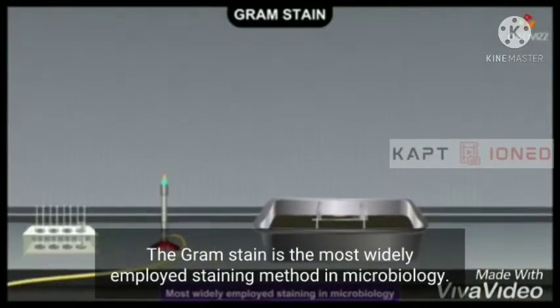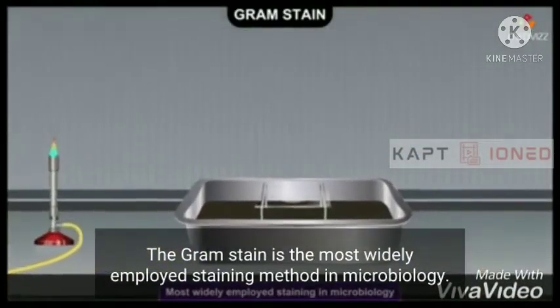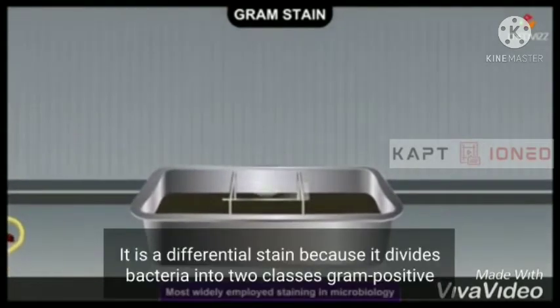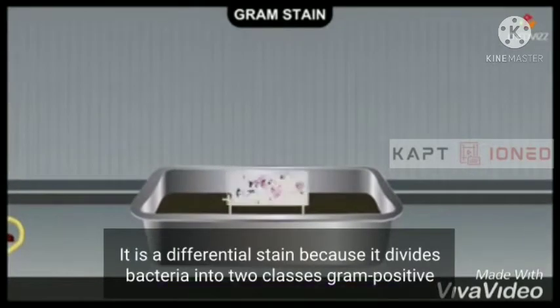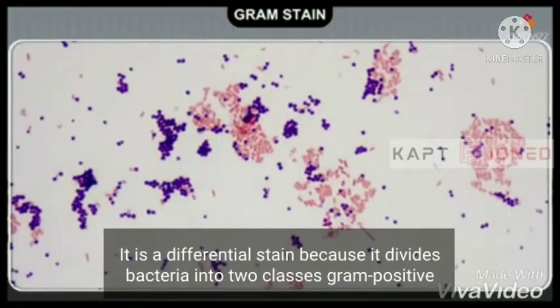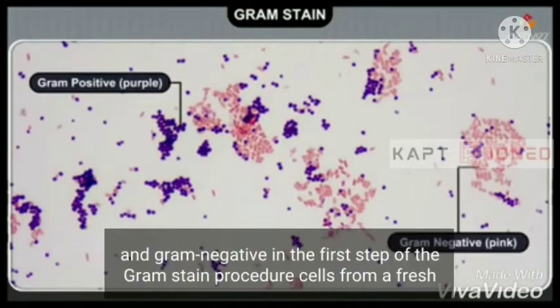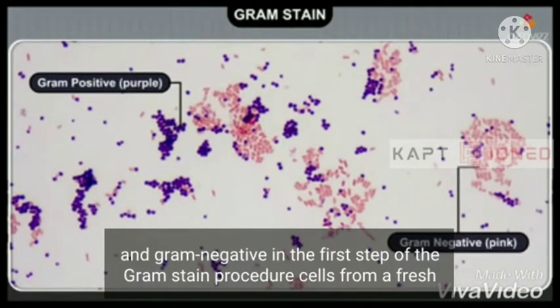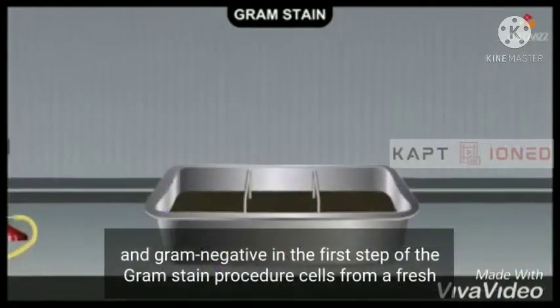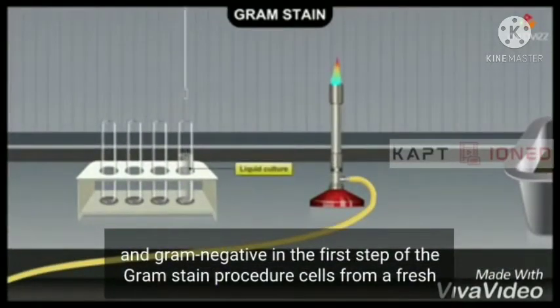The Gram stain is the most widely employed staining method in microbiology. It is a differential stain because it divides bacteria into two classes: Gram-positive and Gram-negative. In the first step of the Gram stain procedure, cells from a fresh culture are transferred to a clean slide.